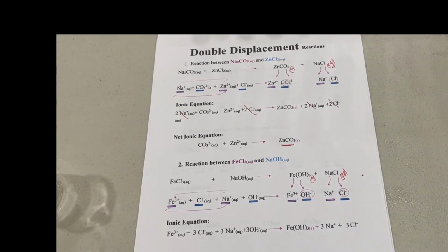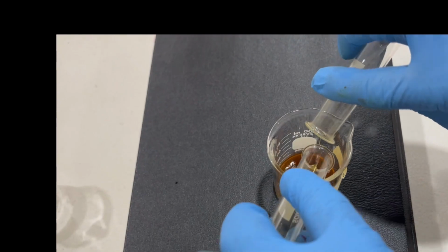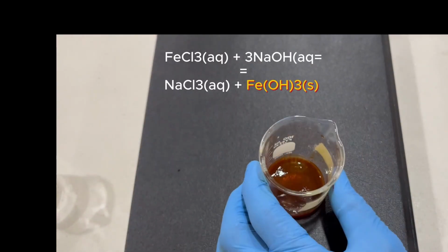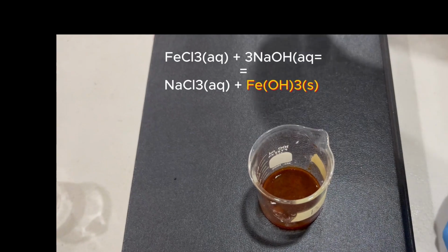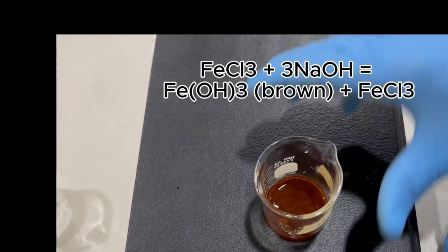Why don't we check that out? So now, react that here. We have iron and OH. You can see right away now you get a reddish brown precipitate. So we are correct in our predictions. Okay, let's see what is the other reaction now.